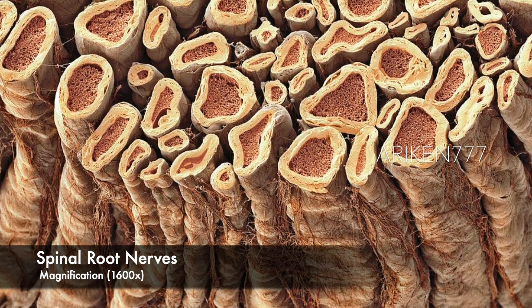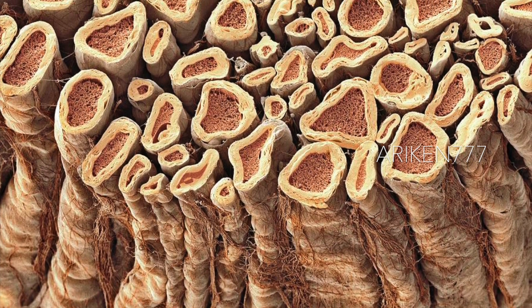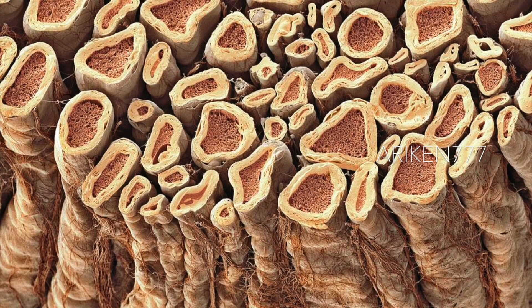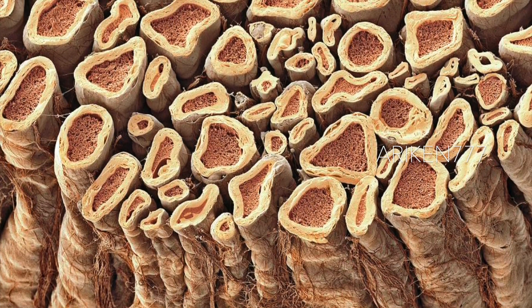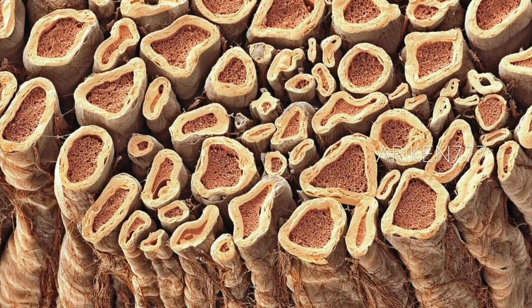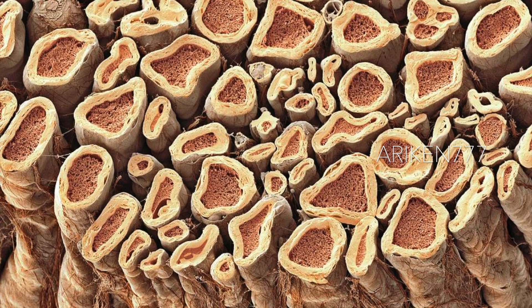A cross-section of a spinal root nerve bundle showing individual axons — extensions of nerve cells. Spinal root nerves are bundles of nerves that connect the spinal cord, part of the central nervous system, with the neural network in the rest of the body. As part of the peripheral nervous system, axons are extensions of nerve cells that transmit nerve impulses between nerve cell bodies.